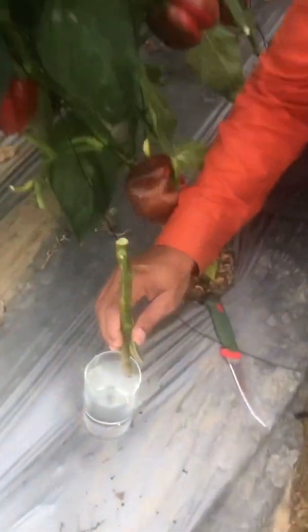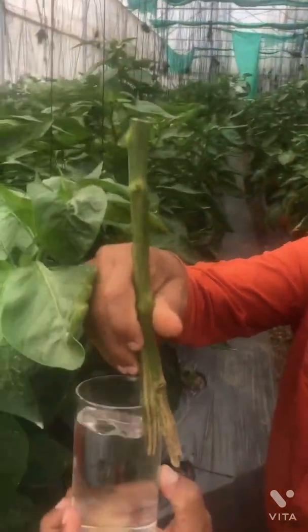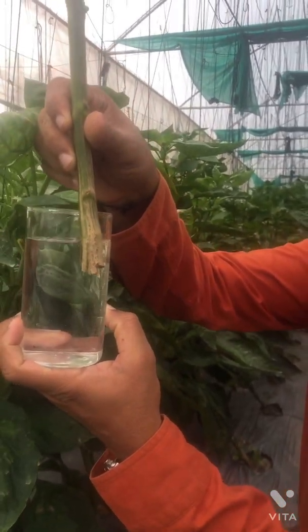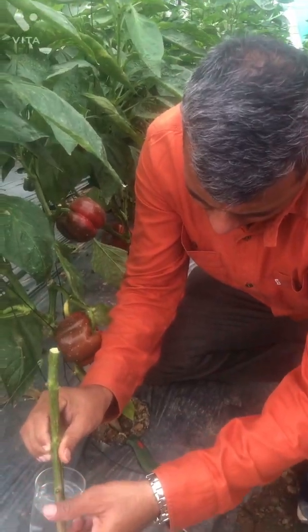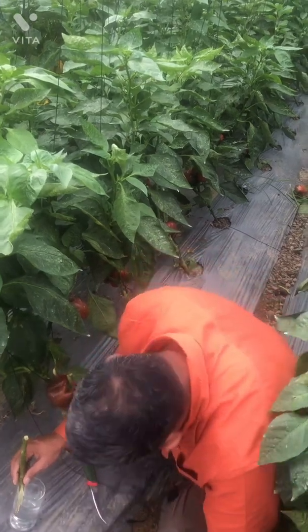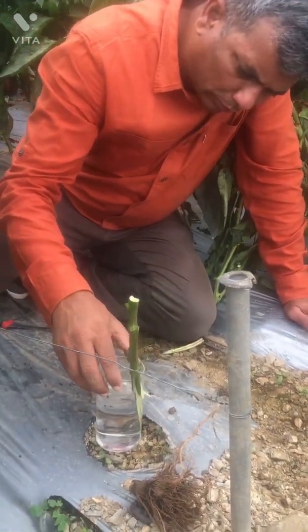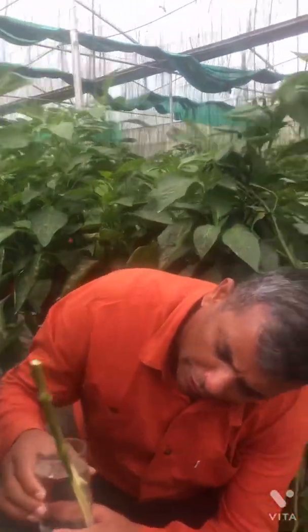We will now perform what is called the ooze test, to see if there is any oozing from the bacterium. If it is bacteria, then a gum-like substance starts oozing out within a couple of minutes. Let me readjust this and wait for the result.